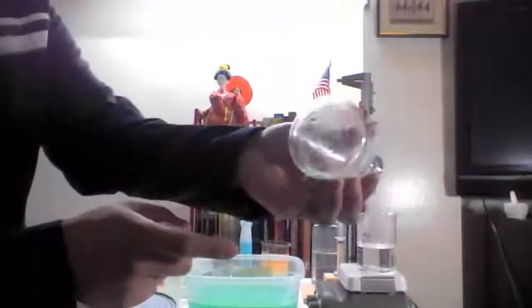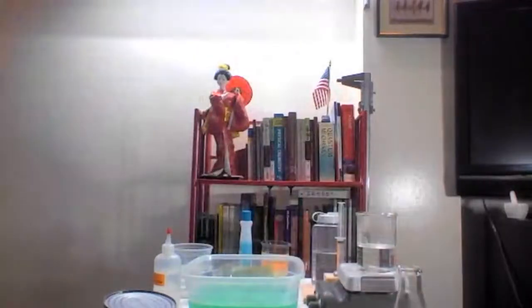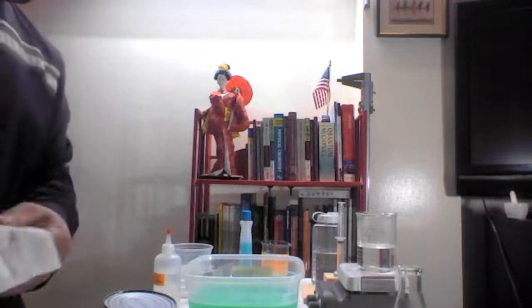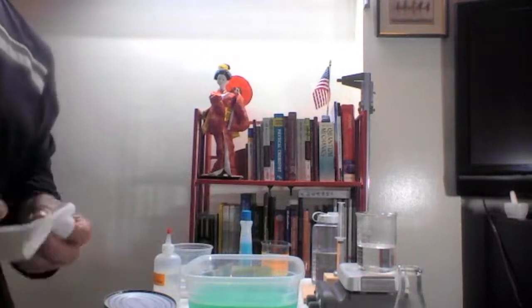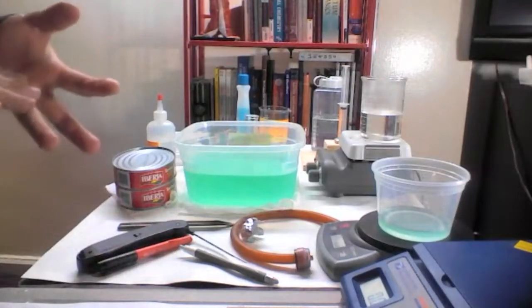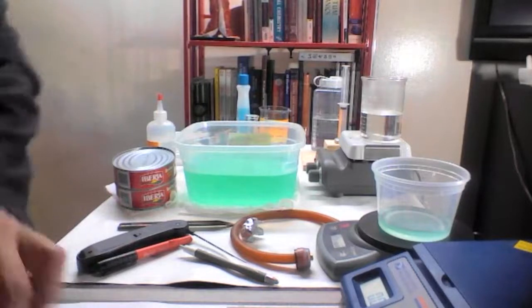So it's only a small amount of liquid here condensed on the walls of the flask. Some droplets, and then you weigh it. So now, according to that, the third mass of the flask, we have like 0.3 grams in there. Okay, so we got all the data that we need, and we're going to take a little break while we set up the board. So 5-minute break, everyone.